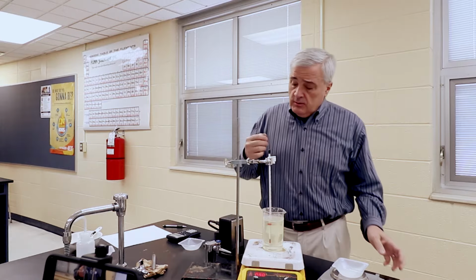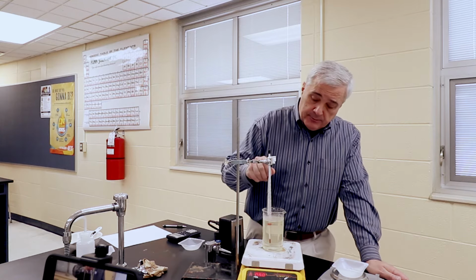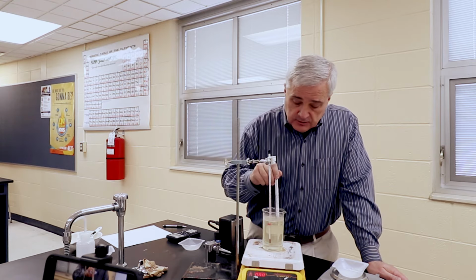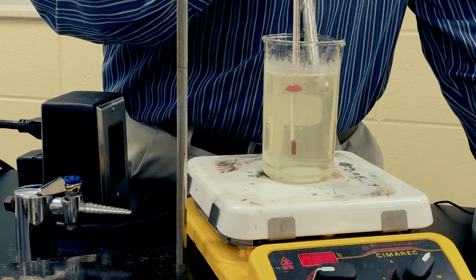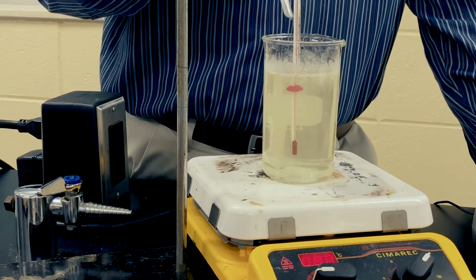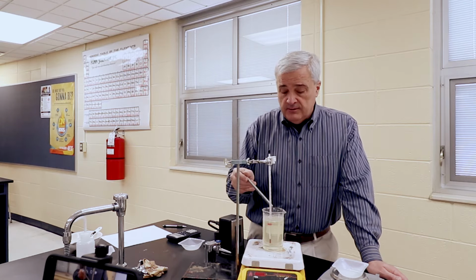All right, the temperature is almost back to 80, which is where we were going for, and it has cleared up. There are still some particles that seem to be suspended, mostly floating on the top of the surface. So I'm using the spatula to break that surface tension and try to get them to go down. Also, I've got sugar crusting on the side that, no matter how much I scrape, I keep scraping more on.